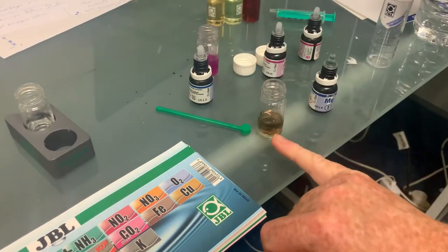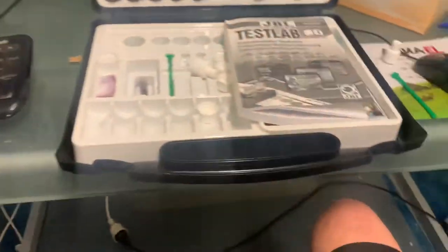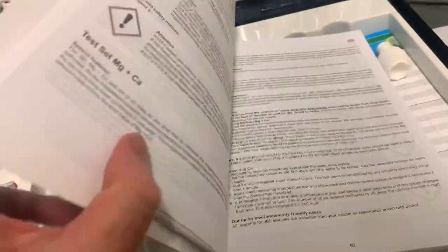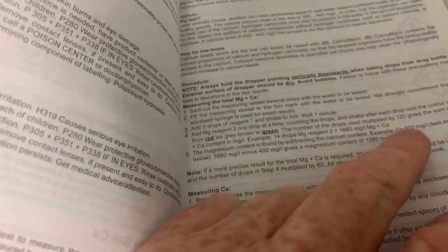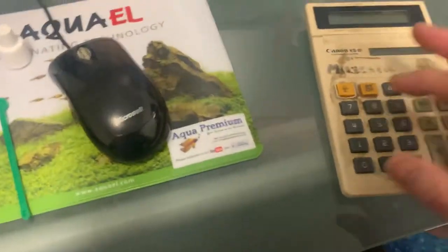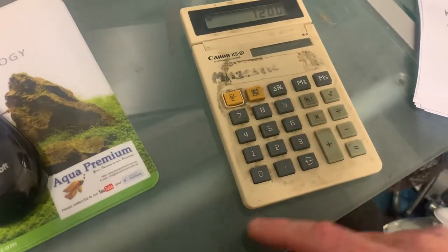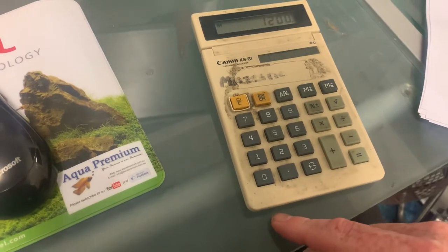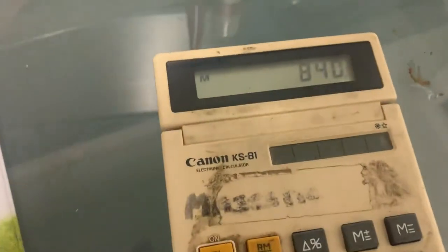See how it's changed to green — that was a very dramatic change from red to green. That was 10 drops. Each drop equals 120, so 10 times 120 is 1200, and then I have to subtract what my calcium level was. So that's 1200 minus the calcium level — which was around 360 — giving 840.